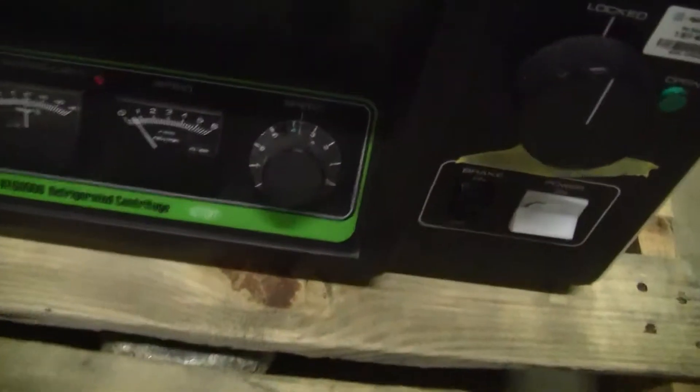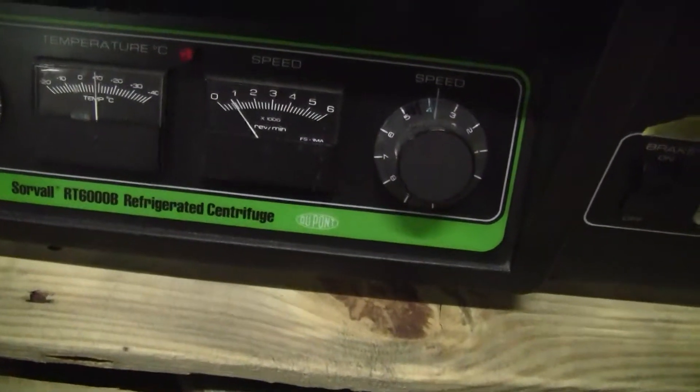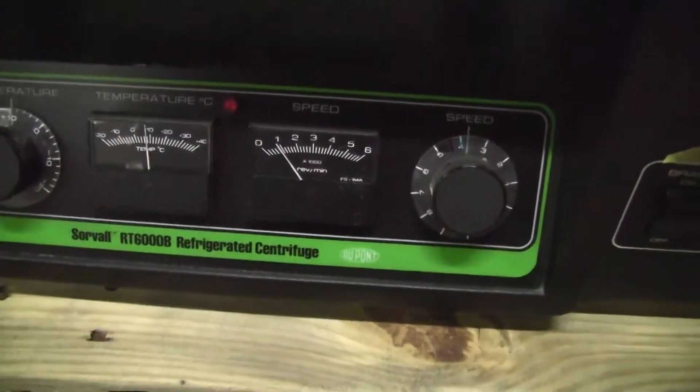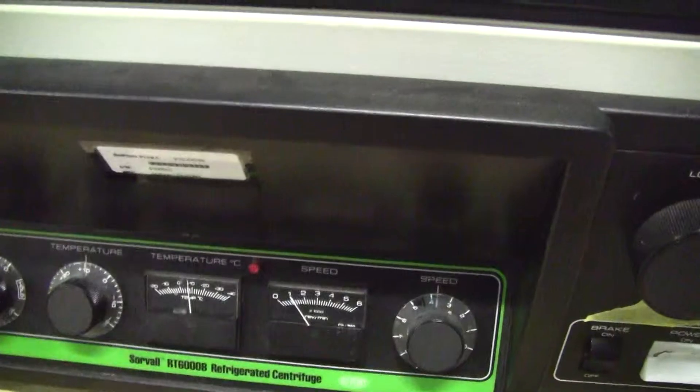You can see it running. The temperature right now is 10 degrees and it is down to 10 — positive plus 10 C. It's shaking a little but we're not on the greatest of surfaces.